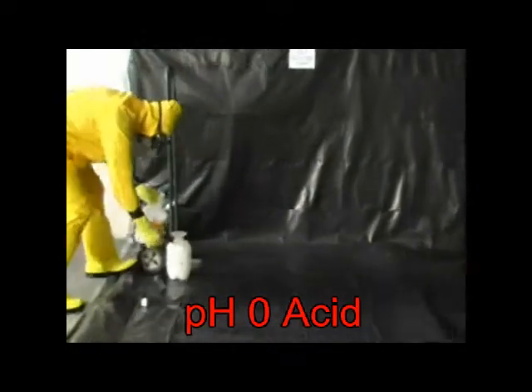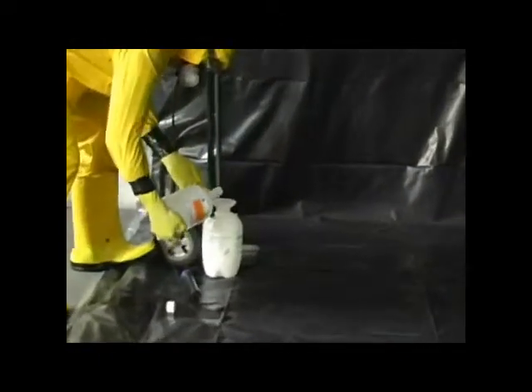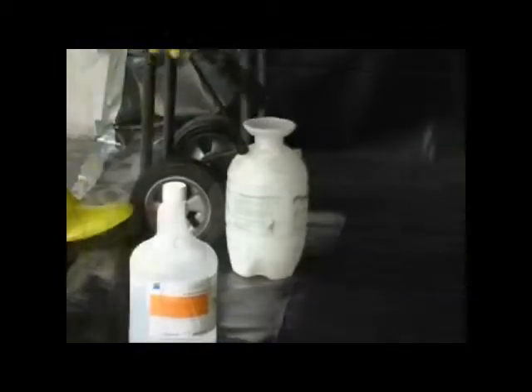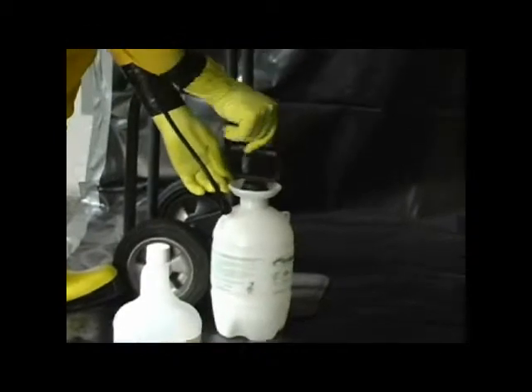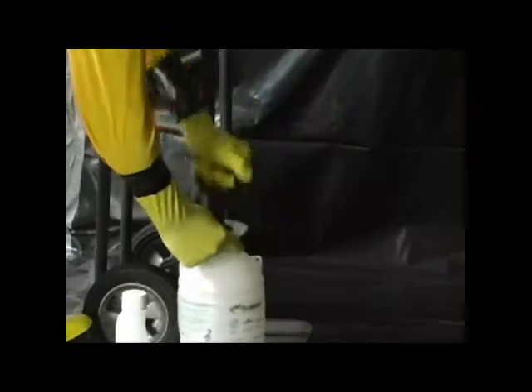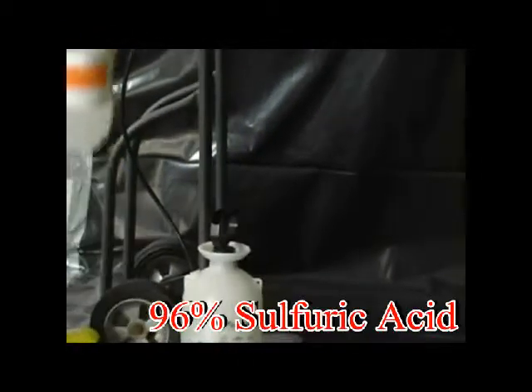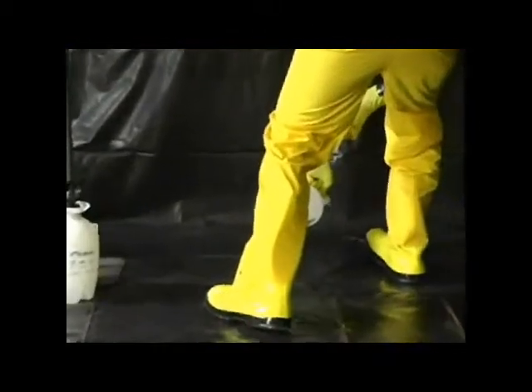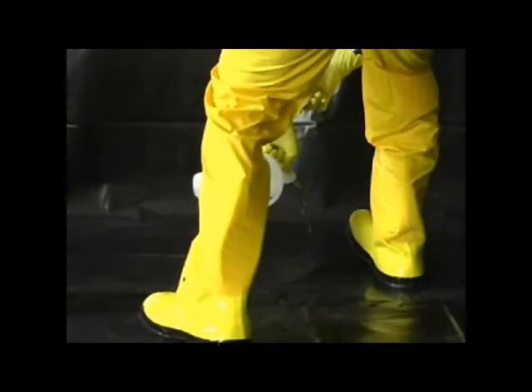The pH 0 sulfuric acid is poured into a small sprayer. The sprayer is pumped up to simulate a small leak. The sulfuric acid, a strong acid, is poured into a pool on the floor, simulating a spill. The sprayers are turned on and the corrosive liquids are sprayed onto the wall.